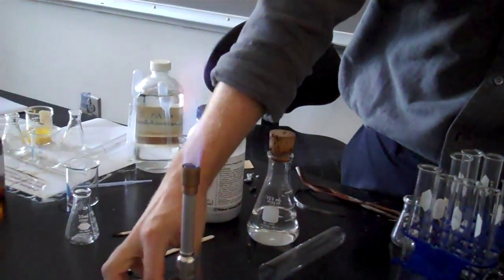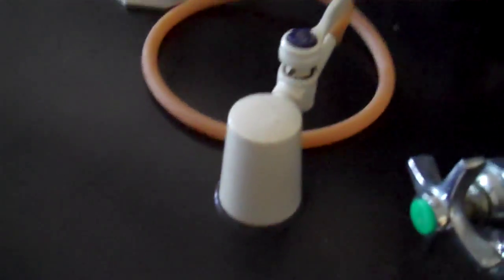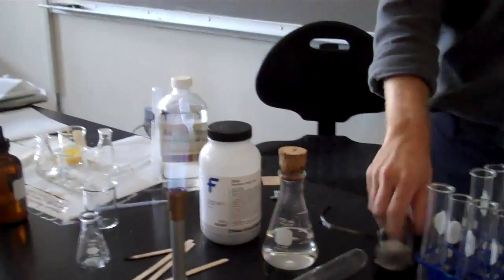Now I will teach you how to use the Bunsen burner. At the end of this period you will get to use it yourselves. Everybody got the goggles on?